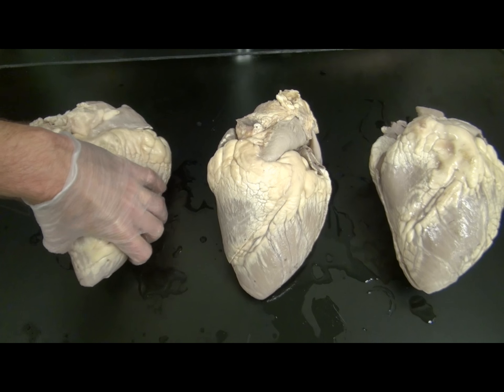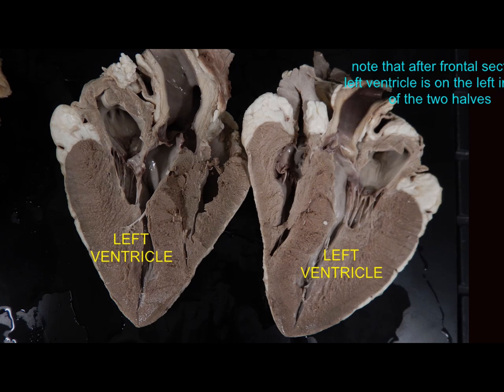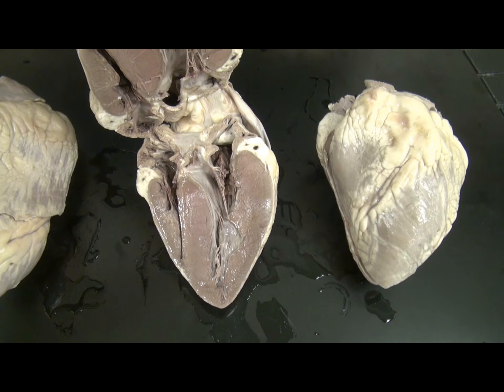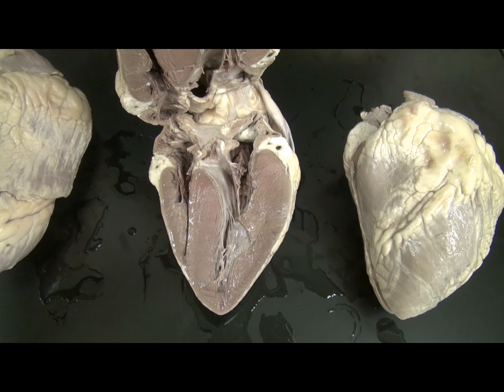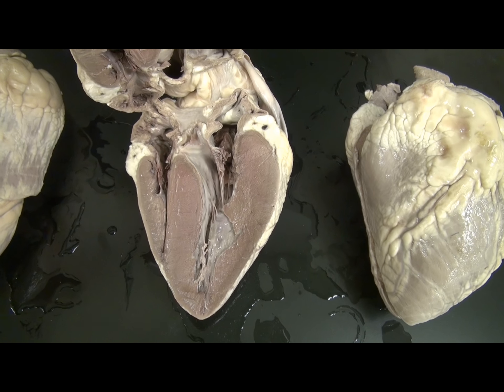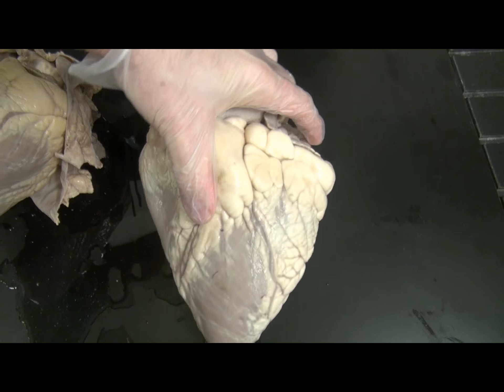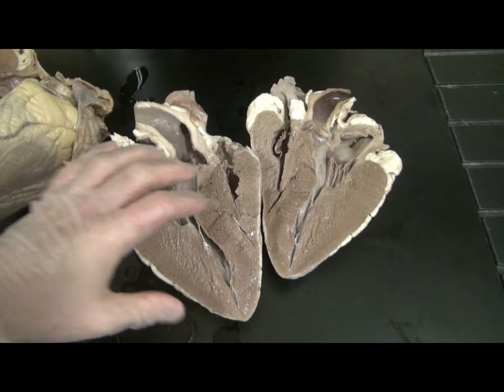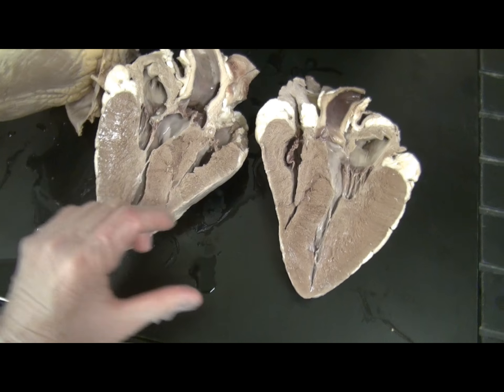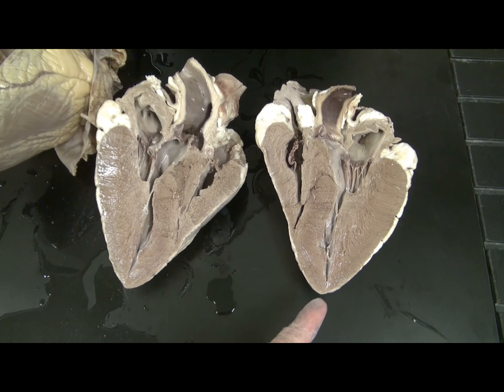If one were to perform a frontal section, the left ventricle does the most work pumping blood throughout the systemic circuit — to the brain and back, to the limbs and back, et cetera — so it would have the thickest wall and make up the apex of the heart. When we look at the heart, the first goal is to identify the left ventricle, which has the thickest wall and makes up the apex.